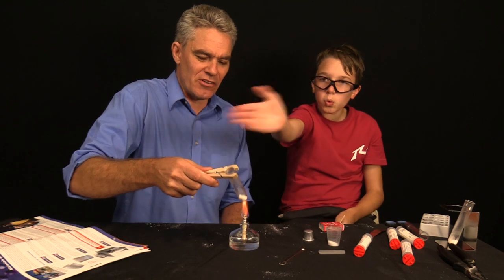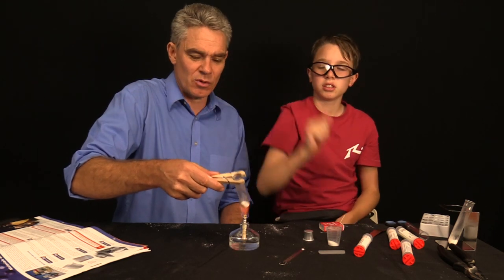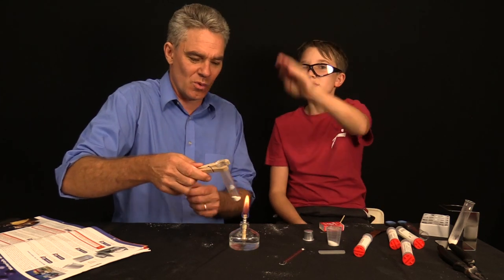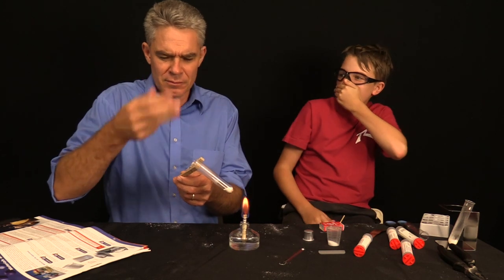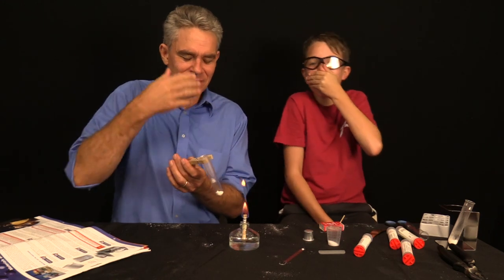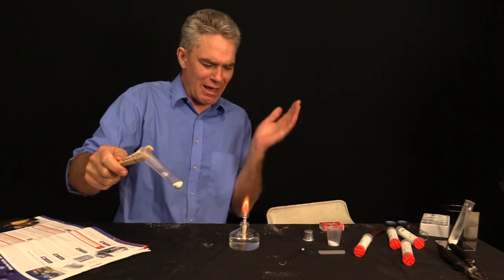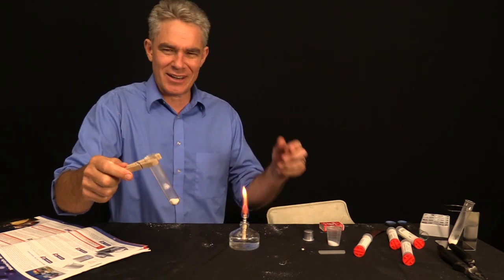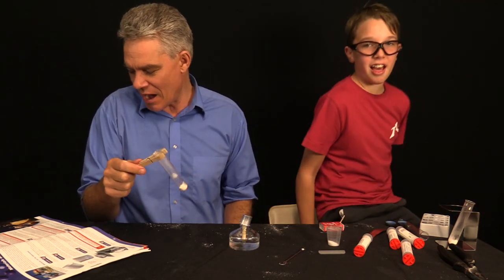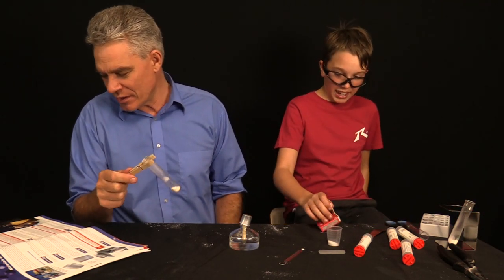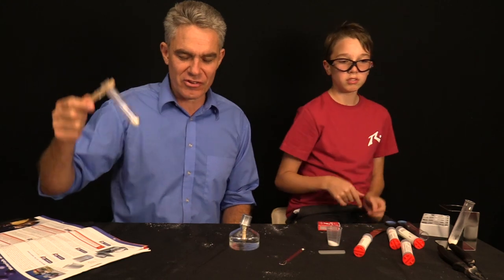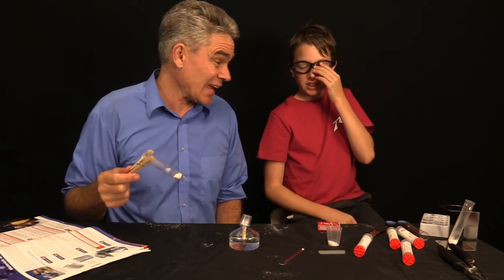Move it around for sure. They're saying that ammonia is going to come off, ammonia gas. Ammonia is a very strong smelling toxic chemical. So, to smell it, how would you smell a toxic chemical? Waft it. That's right. You'll waft it. I smell something bad. Oh, yikes. We'll open up the door. No, don't open up the door. It'll be all right.